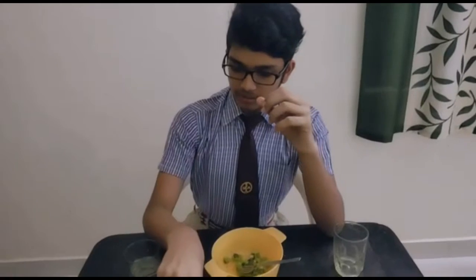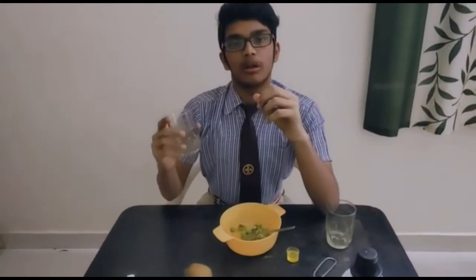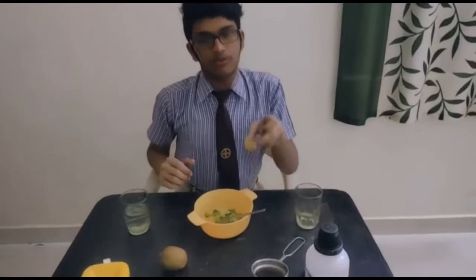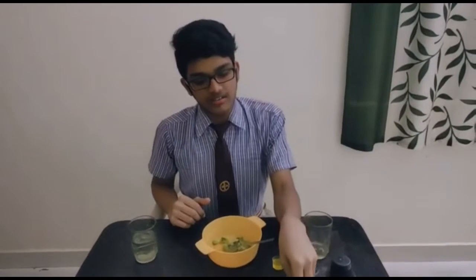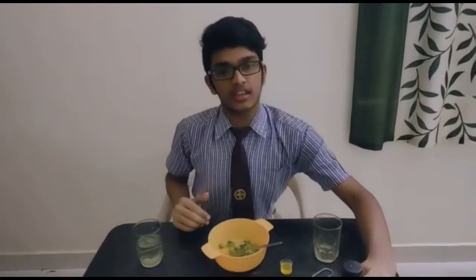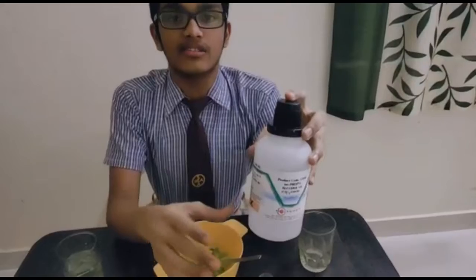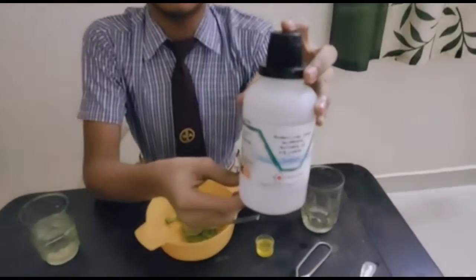It is better to take a soft fruit like kiwi, strawberry, or banana. Here I have taken a kiwi. Next we need 100 ml of water, 5 ml of dishwashing liquid, 2 grams of salt, a tea strainer — you can even use a coffee filter — and the main thing is isopropyl alcohol that should be ice chilled, or ethanol or methylated spirit.